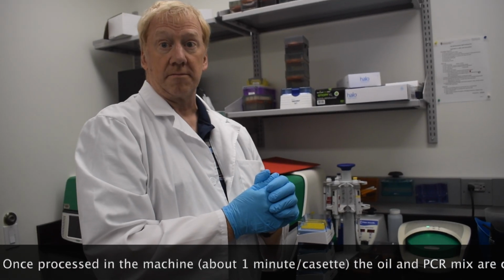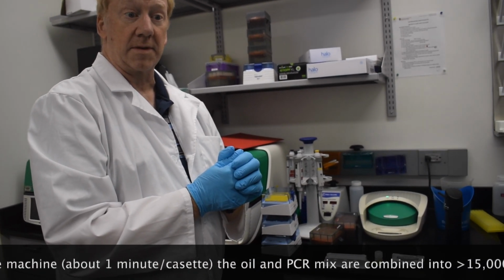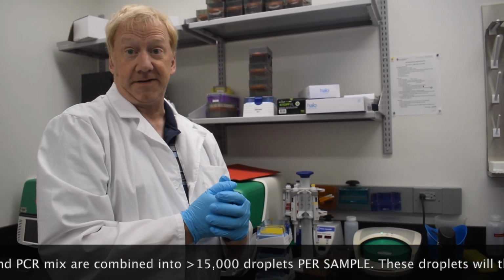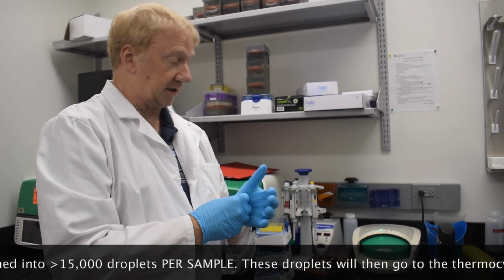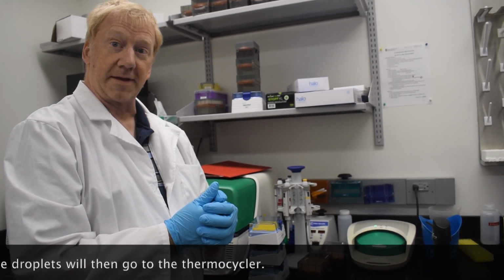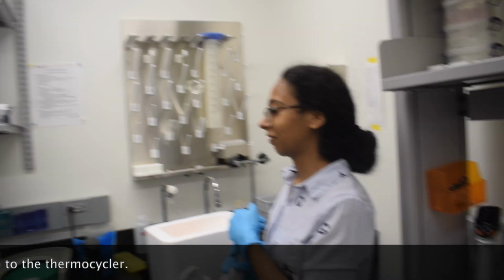So in every single well that you load, about how many PCR reactions are you expecting? We typically get between 15 and 20,000. So in one well, it's 20,000 PCR reactions. That's correct. Wow.